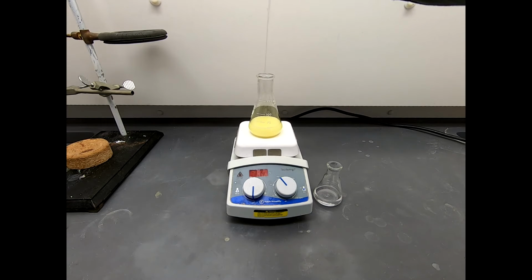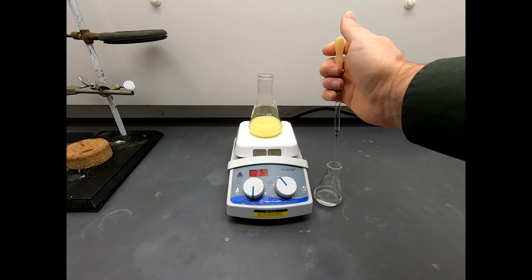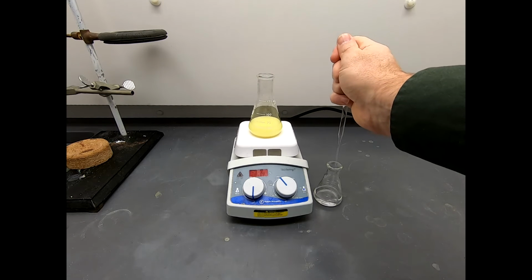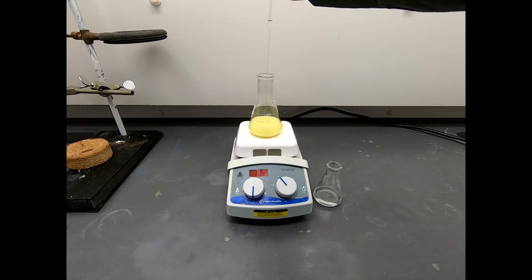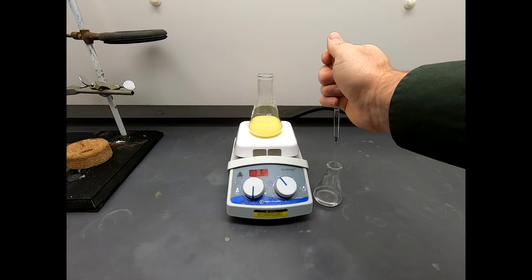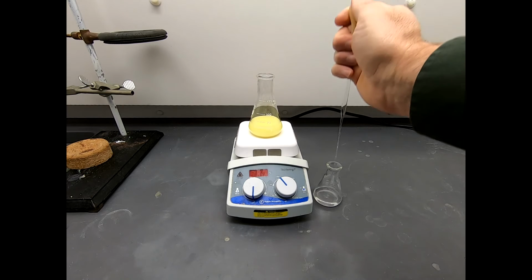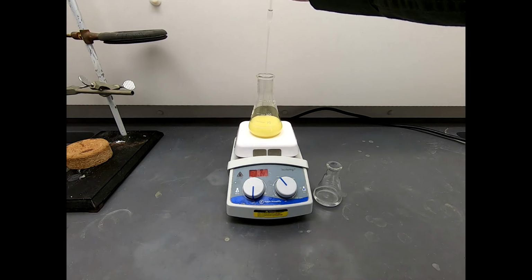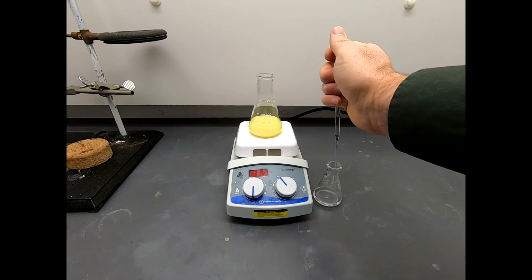Now, unfortunately, there's not a whole lot more dramatic to see in this reaction, because once it goes cloudy, I mean, that's kind of the big finish. Now, what is happening is, even though some of the product may have formed, as we're adding more of the reagents, now more and more product will form. So this will hopefully get thicker and thicker with precipitate. And we are getting close to being done with this addition.